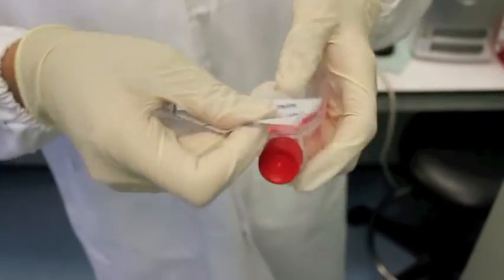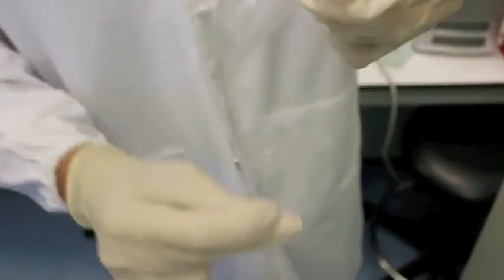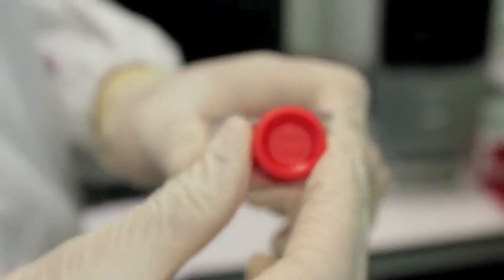You should neither parafilm nor tighten the cap of the cell culture flask before placing it into the incubator. Loosen the cap slightly so that carbon dioxide can diffuse into the flask easily.